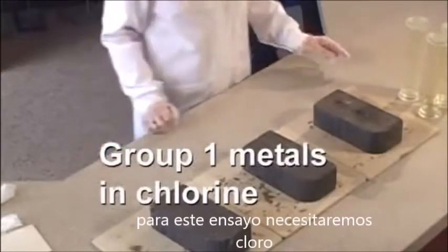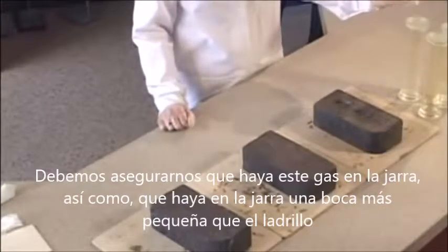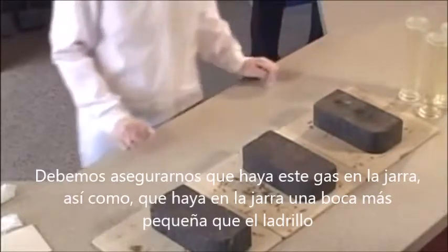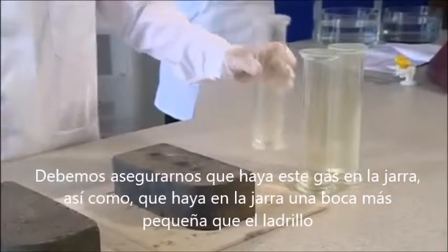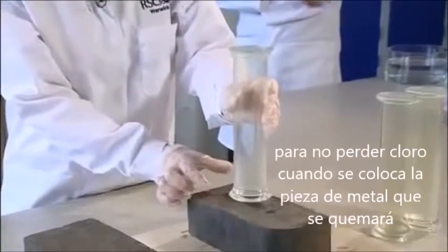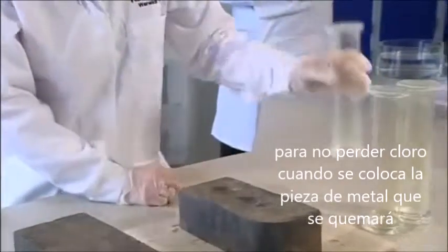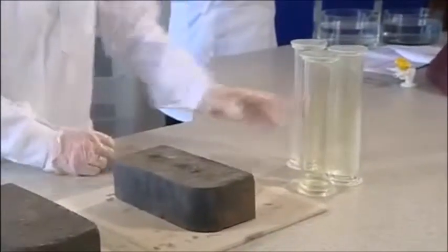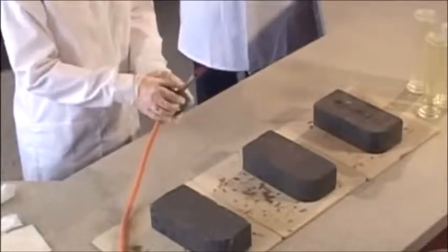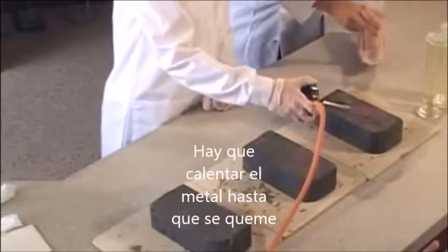For this you will need some previously prepared chlorine stored in a gas jar sealed with Vaseline. You should make sure that there is a green colour of the gas in the gas jar. You should also make sure that the opening of the gas jar is smaller than the brick, so you don't lose the chlorine out when you put it over the burning piece of metal. Heat the metal up till it's burning.